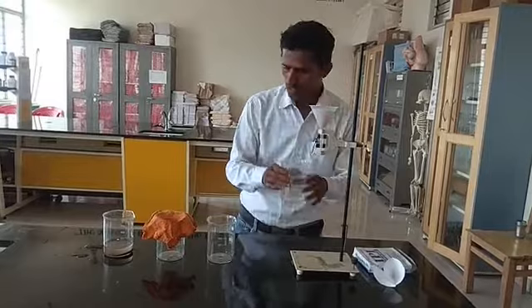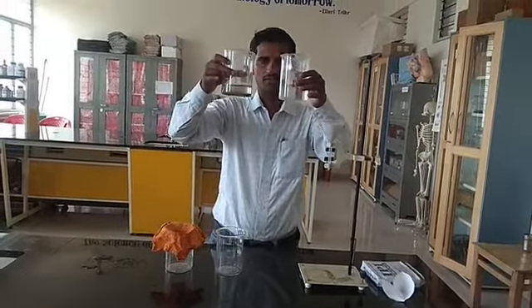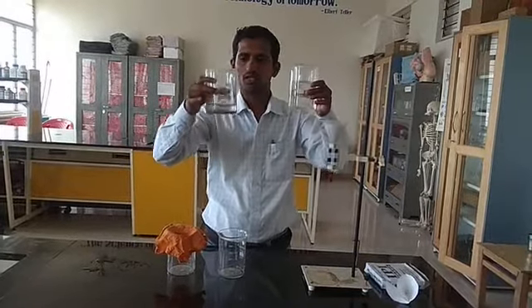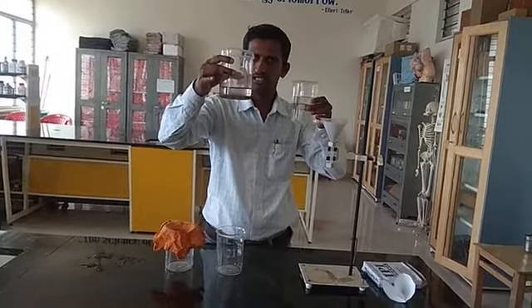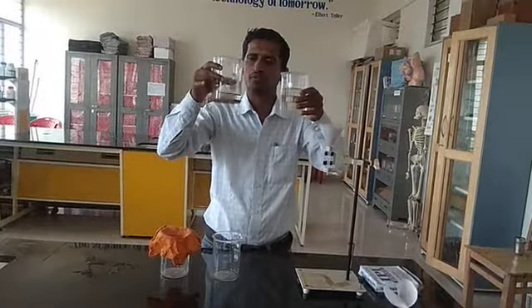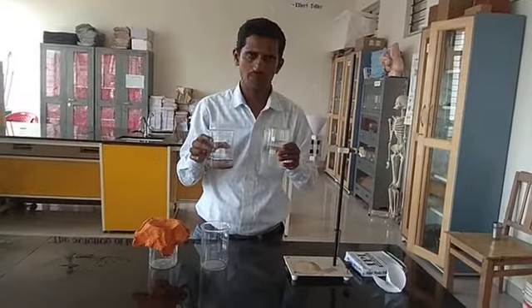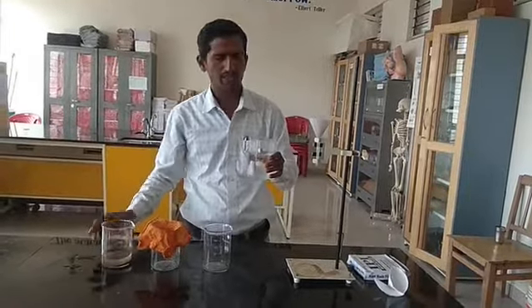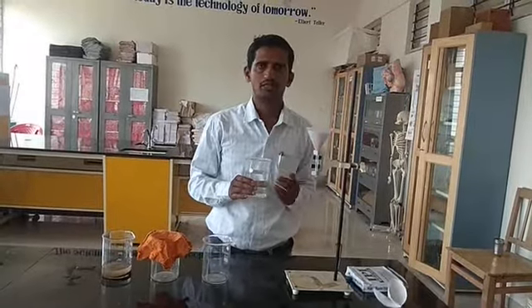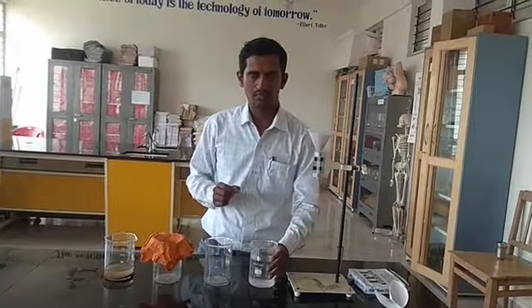Now observe — look at the first beaker and look at the last beaker. Have you got pure water out of muddy water? Yes! This activity shows that we can get pure water from muddy water by using sedimentation, decantation, and finally filtration through a strainer, cloth, and filter paper. I hope you have understood this concept and can perform this activity when you come back to school. Note all the definitions and study. Thank you, have a nice day.